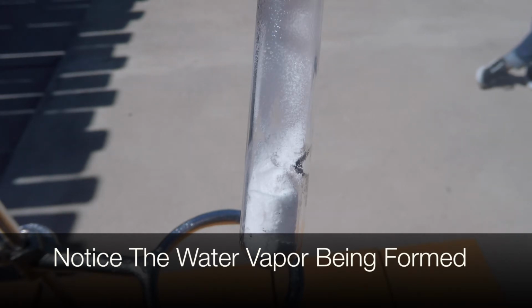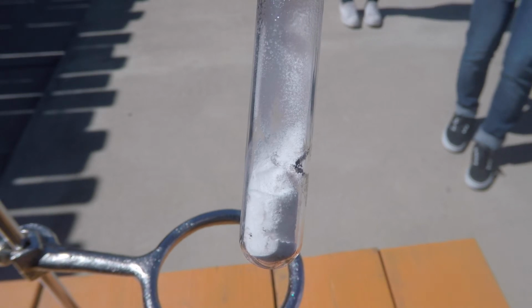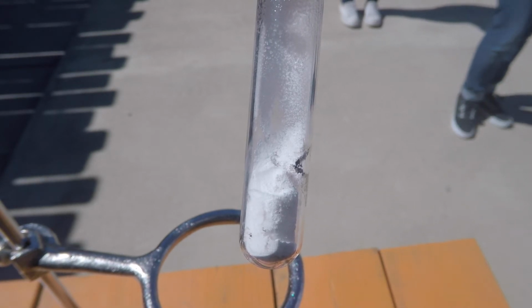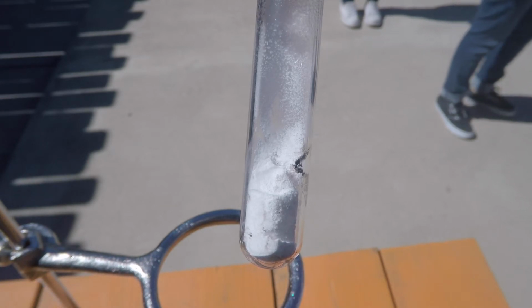Instantly, what do you see? Everyone come take a look. Condensation. You see condensation. Is that water vapor? Water? Yeah, that's what you said. So we have water vapor. What does that tell you? There's two reactions that have water. So does that eliminate one of the reactions? Yes, that eliminates one of the reactions, does it not?